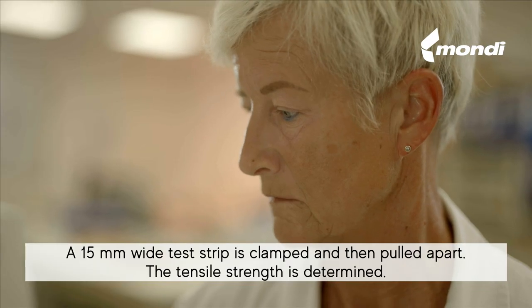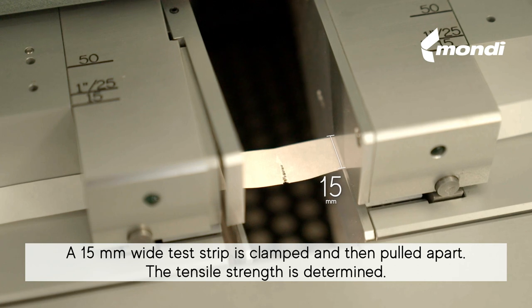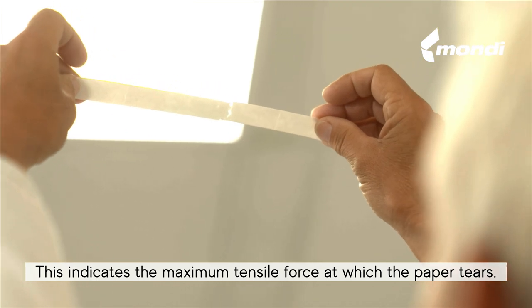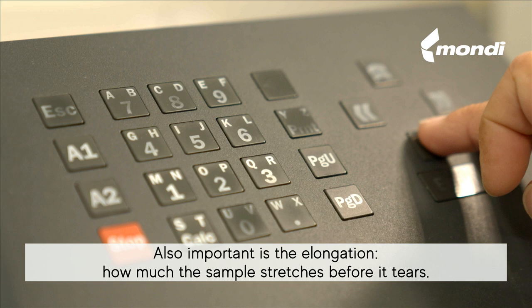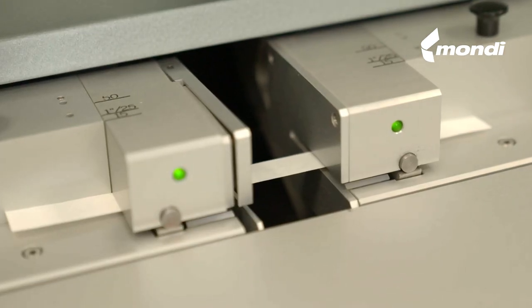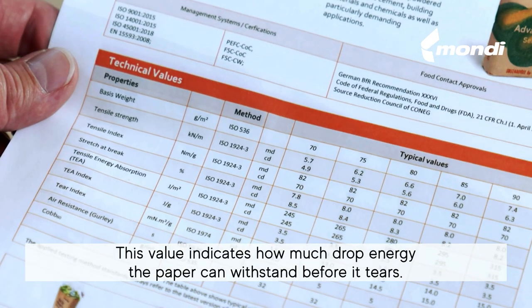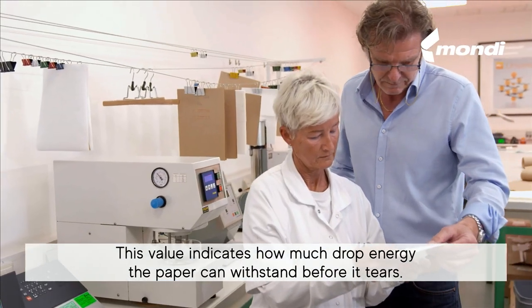A 15-millimeter wide test strip is clamped and then pulled apart to determine the tensile strength. This indicates the maximum tensile force at which the paper tears. Also important is the elongation — how much the sample stretches before it tears. Both values together result in the essential value: tensile energy absorption, which indicates how much drop energy the paper can withstand before it tears.